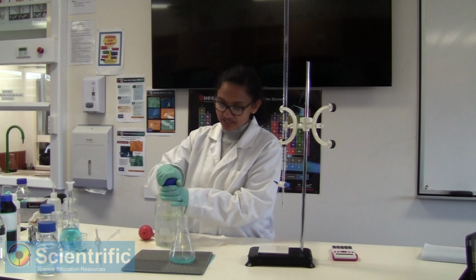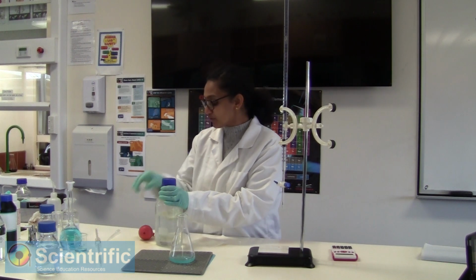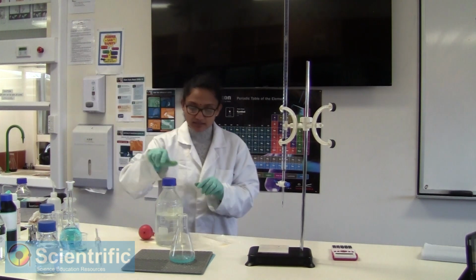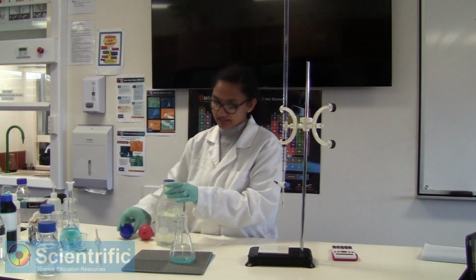Now we just need to add a few drops of our acid so that it's slightly acidic.